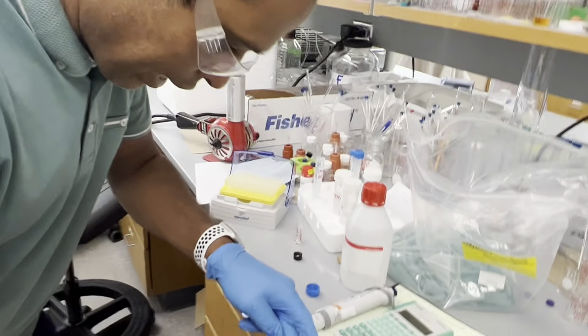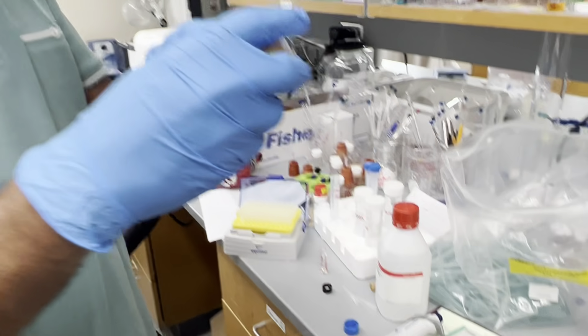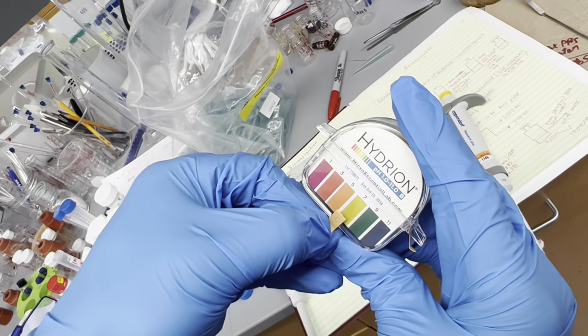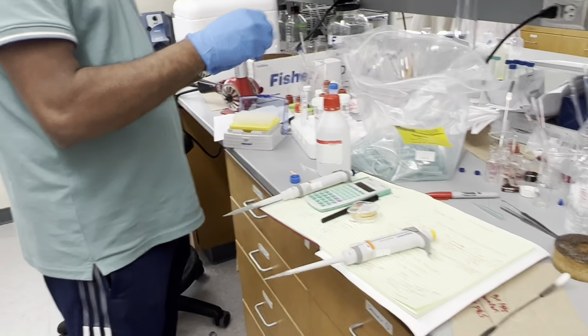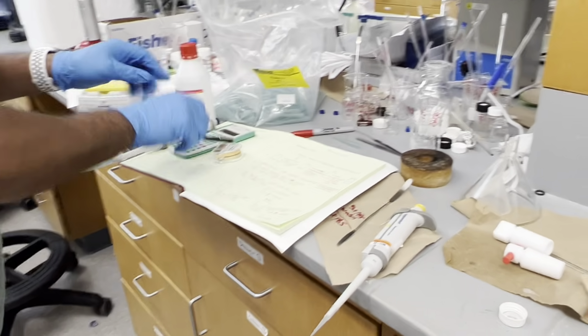Yeah, so I think, like, not 5 exactly, but it is getting changed. If you see the color here, like 7, we don't want 7. It should be like acidic mode. So it looks close enough, 5 enough. So I think it's enough. Yeah, so we are not adding any more acid. We added 30 microliter. So whatever the difference is, we add more of the DMSO.